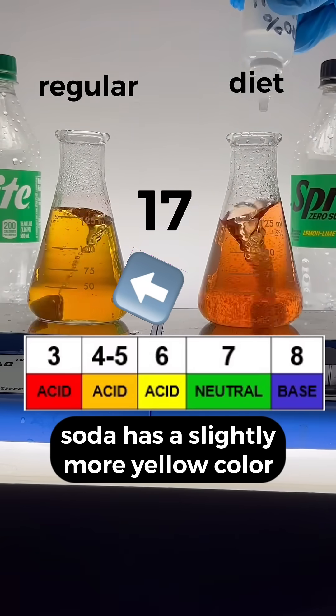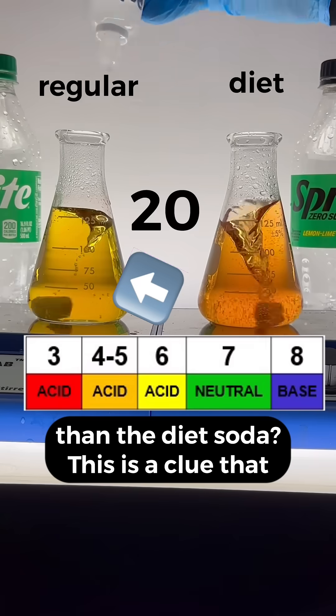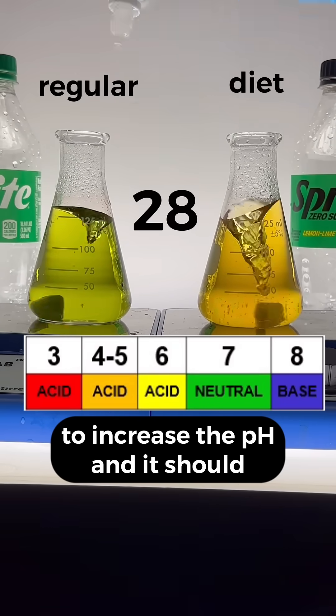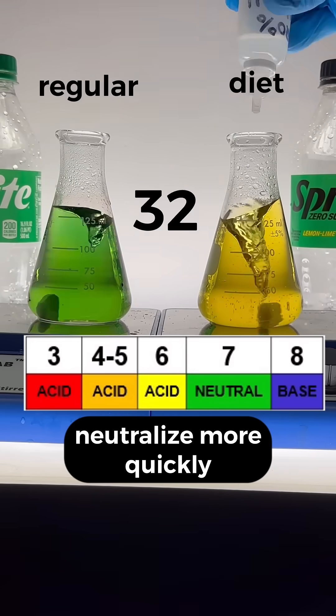Do you notice that the regular soda has a slightly more yellow color than the diet soda? This is a clue that the regular soda requires less base to increase the pH, and it should neutralize more quickly.